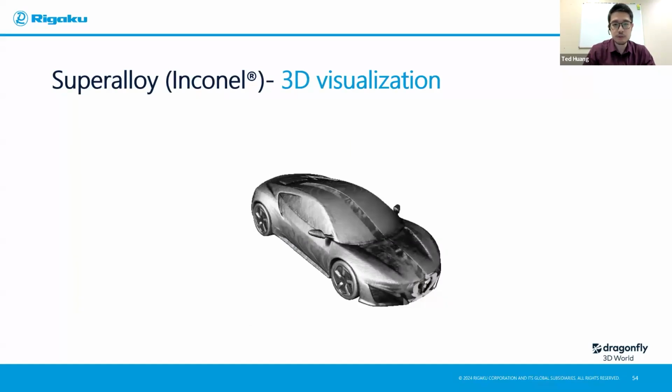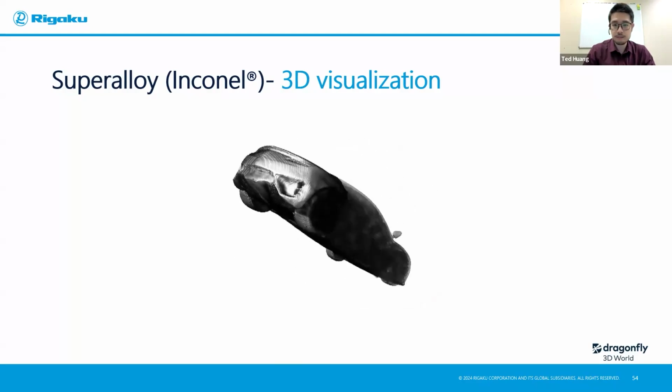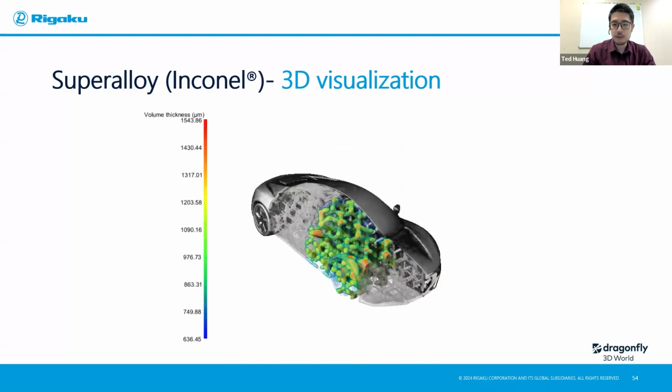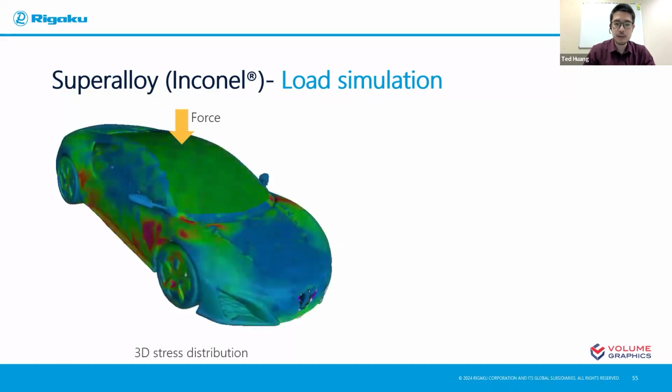Before that, I would like to show you just a 3D visualization of the analysis that I just did. Just an overall grayscale rendering to show you the structure as well as the volume thickness, but this time in a 3D fashion. So we're interested in the load distribution it might be subjected to, right? So let's put it into an actual simulation and do a load distribution analysis to see how it goes. In this case, I made a condition as if the car is being pressed evenly from the top of its ceiling, with some force pressing against it. And with the simulation, the outcome is here.